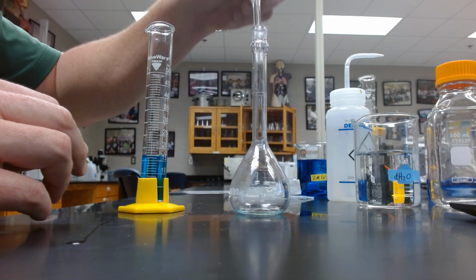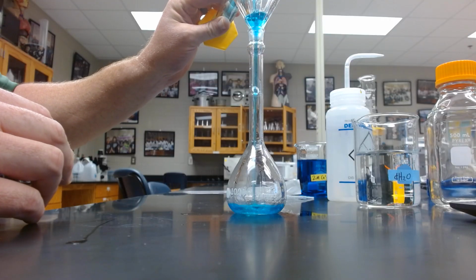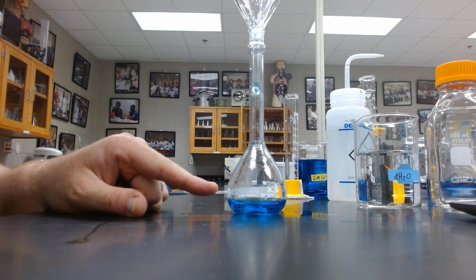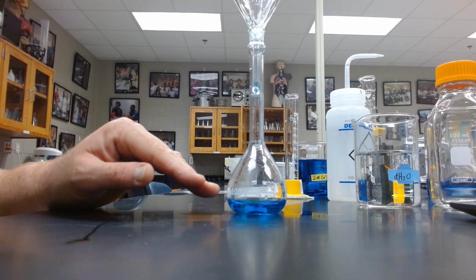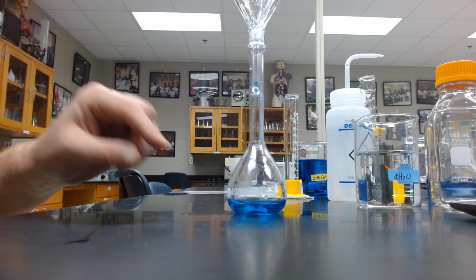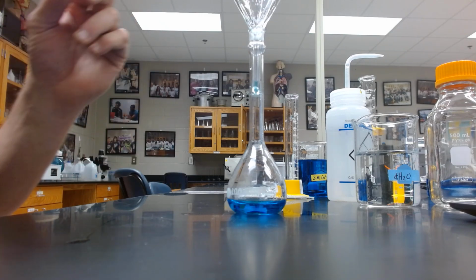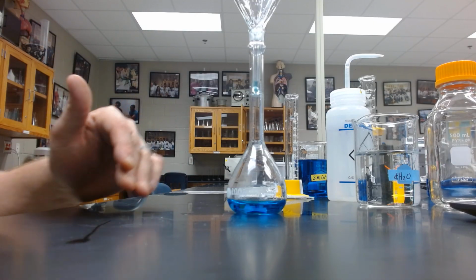I'm going to use a funnel to prevent spills. And now we'll add our concentrated 2 molar solution to our volumetric flask. So the concentration of this solution is still 2 molar. We have not diluted. Now as we add distilled water to it, it is going to slowly dilute until we reach our desired mark. So every drop we add takes this away from 2 molar. A little bit added to it, we start seeing 1.99, 1.98, 1.97, 1.9, 1.8, 1.7, and so forth. So we will be diluting it.